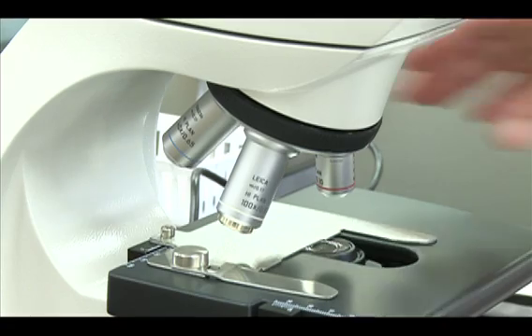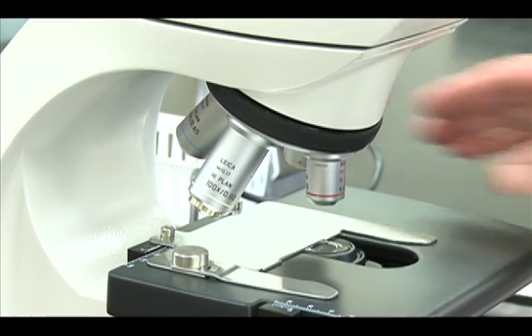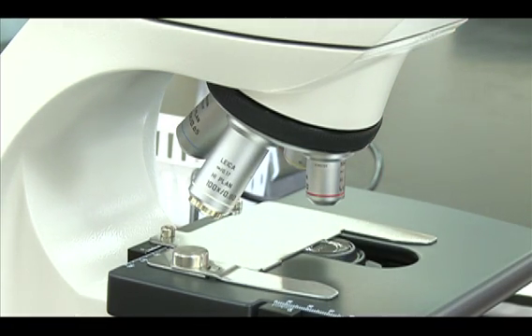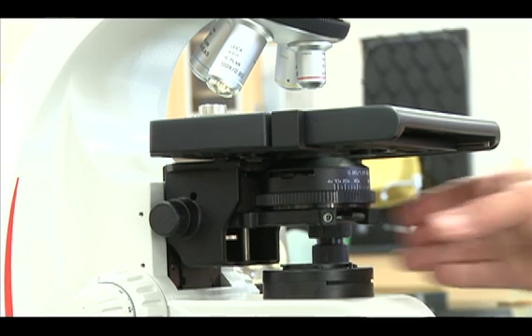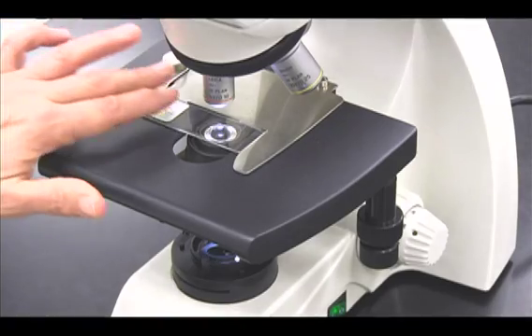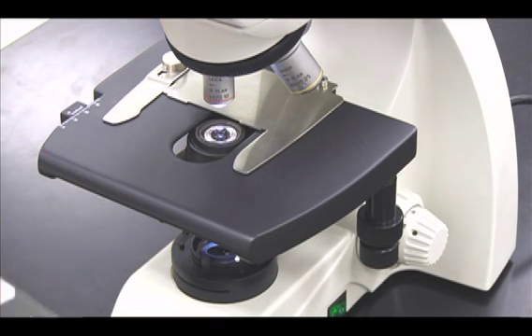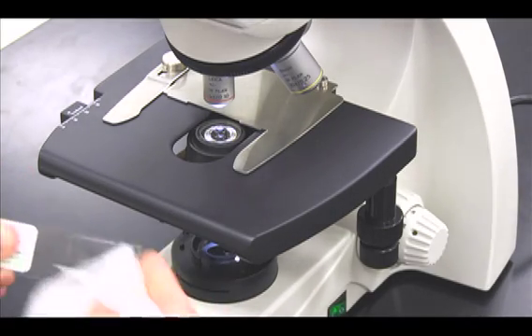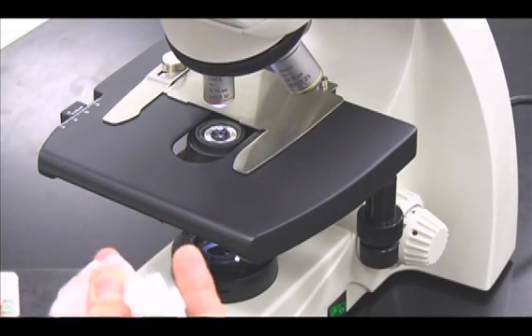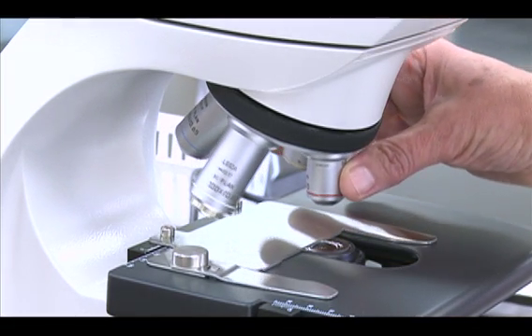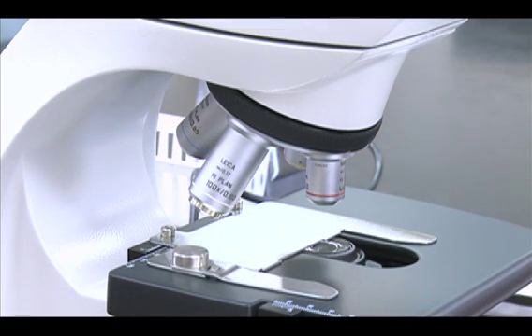To change your slides or to put your microscope away, rotate the 4x objective back into position and set the iris diaphragm ring to 4x. Gently remove your slide, thoroughly remove the oil from it, and return it to the tray. Never remove a slide unless the 4x objective is in place.